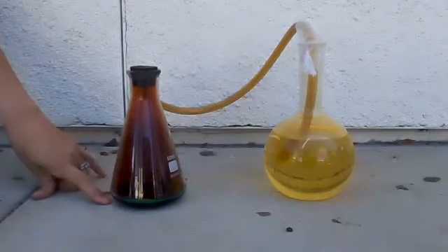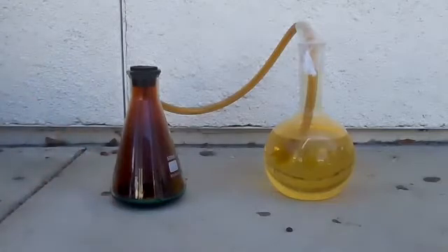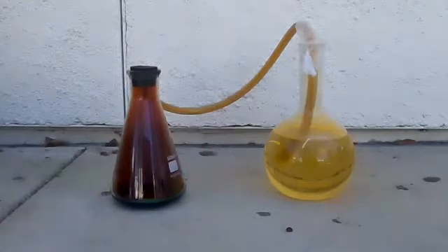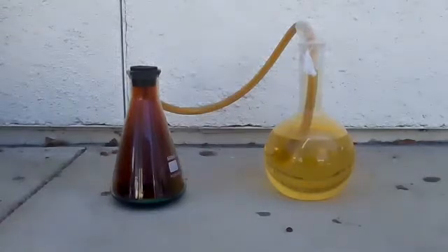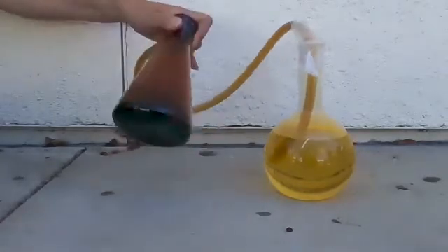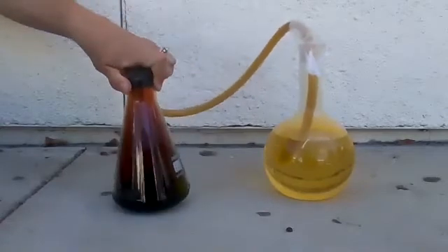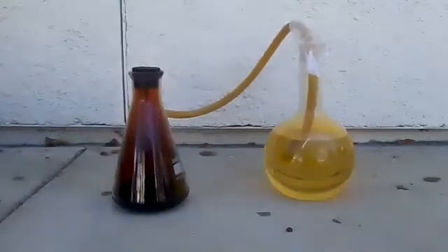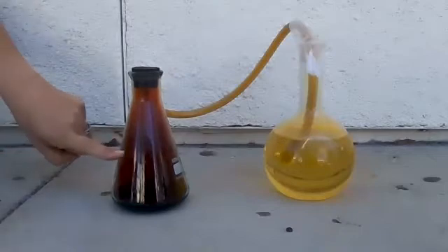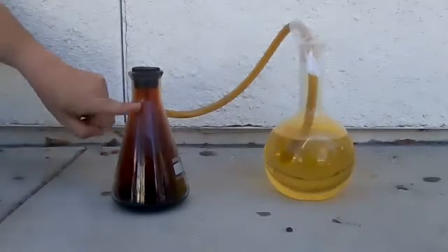The Cu²⁺ can now join together with NO₃⁻ to make Cu(NO₃)₂ — that's the green stuff at the bottom, copper nitrate. But some of the nitrate breaks up and turns into NO2, so that's the brown nasty gas.